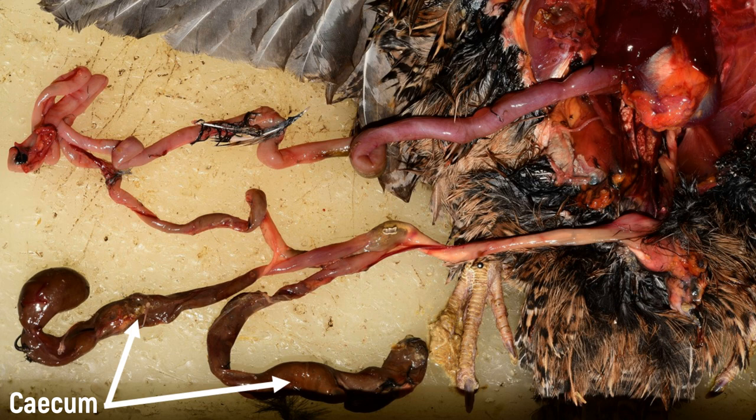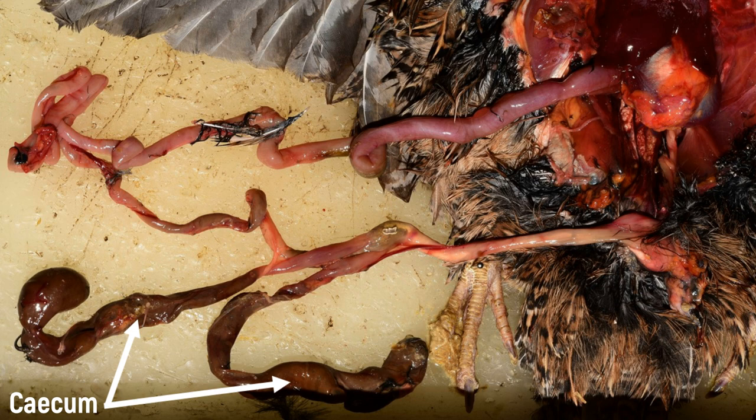In pigeons, the columbiforms, however, they are only a few centimeters long. They are completely absent in cranes and their allies, the gruiforms.